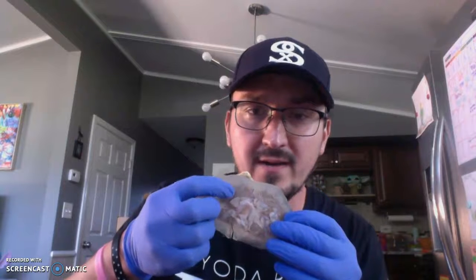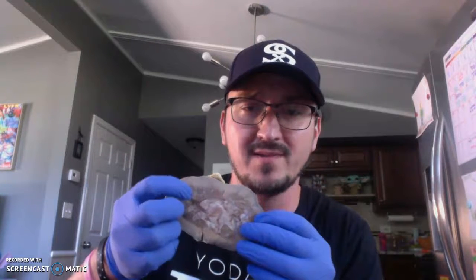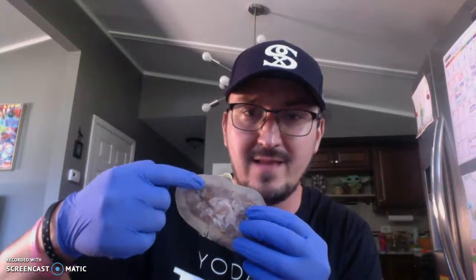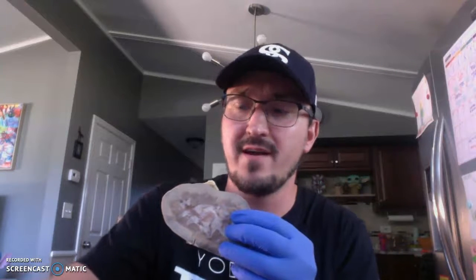Within the medulla, in these dark triangular sections, that's actually the pyramids — the renal pyramids. And then in between those triangular sections, there are lines here — those are actually the renal columns.